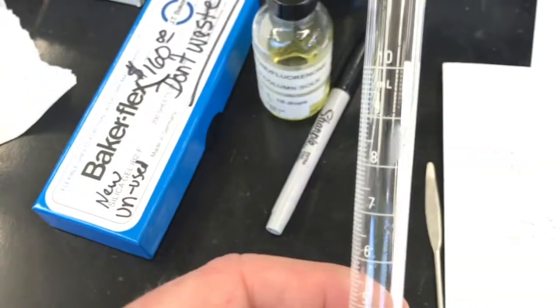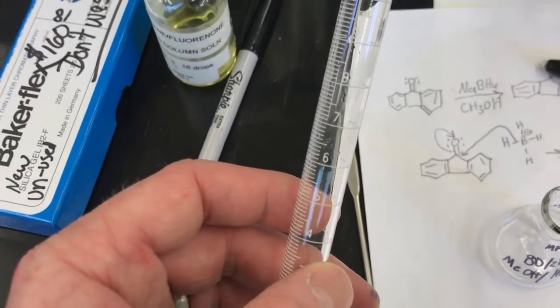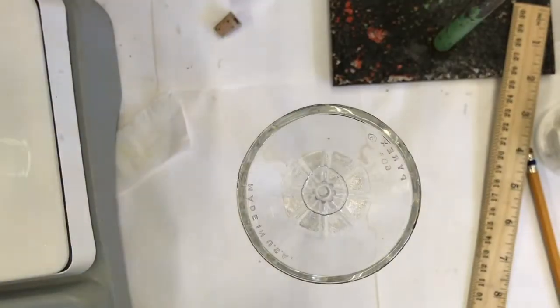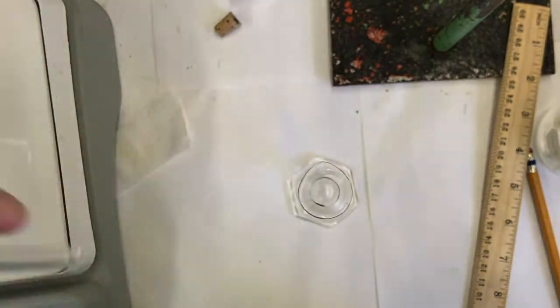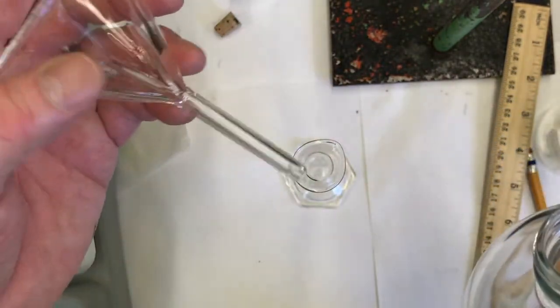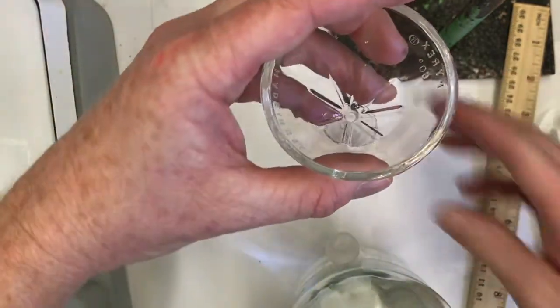Let me prepare that. It's simple enough, 80-20. I think 10 milliliters will be plenty. So I will fill this graduated cylinder to about 8 milliliters with methanol, and then fill it all the way up to 10 with water. 8 milliliters of methanol is a little on the higher end, so instead of pipetting constantly, like 10 times, I'll use the short stem funnel to get it close to 8 milliliters, and then I will pipette the last bit.